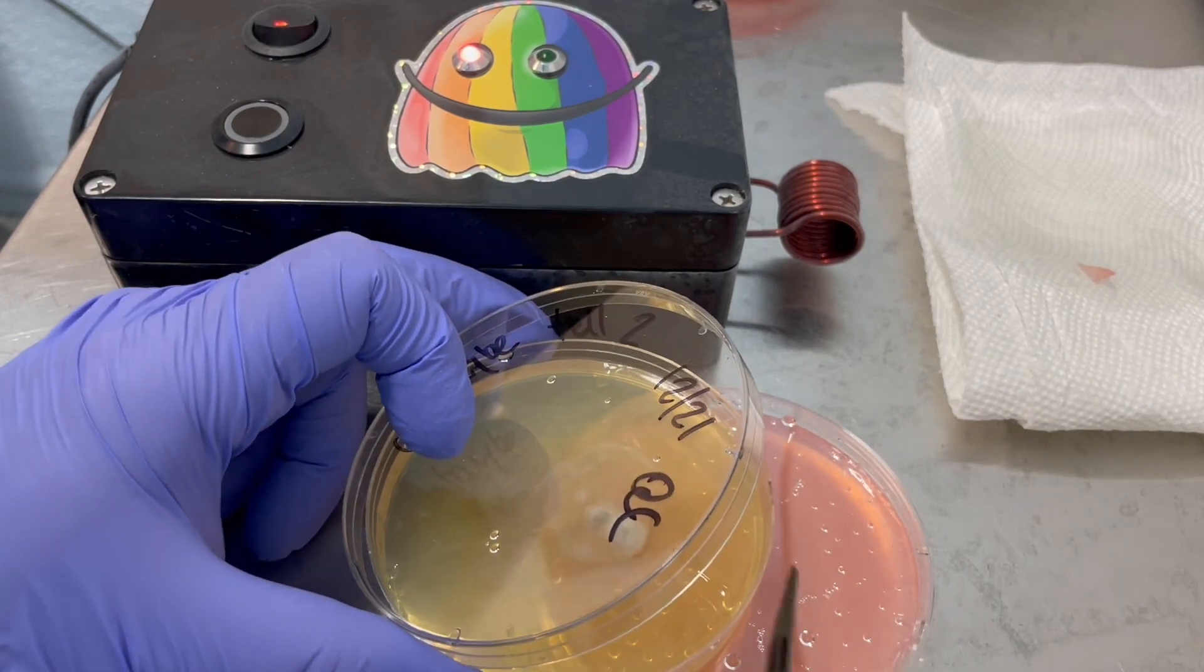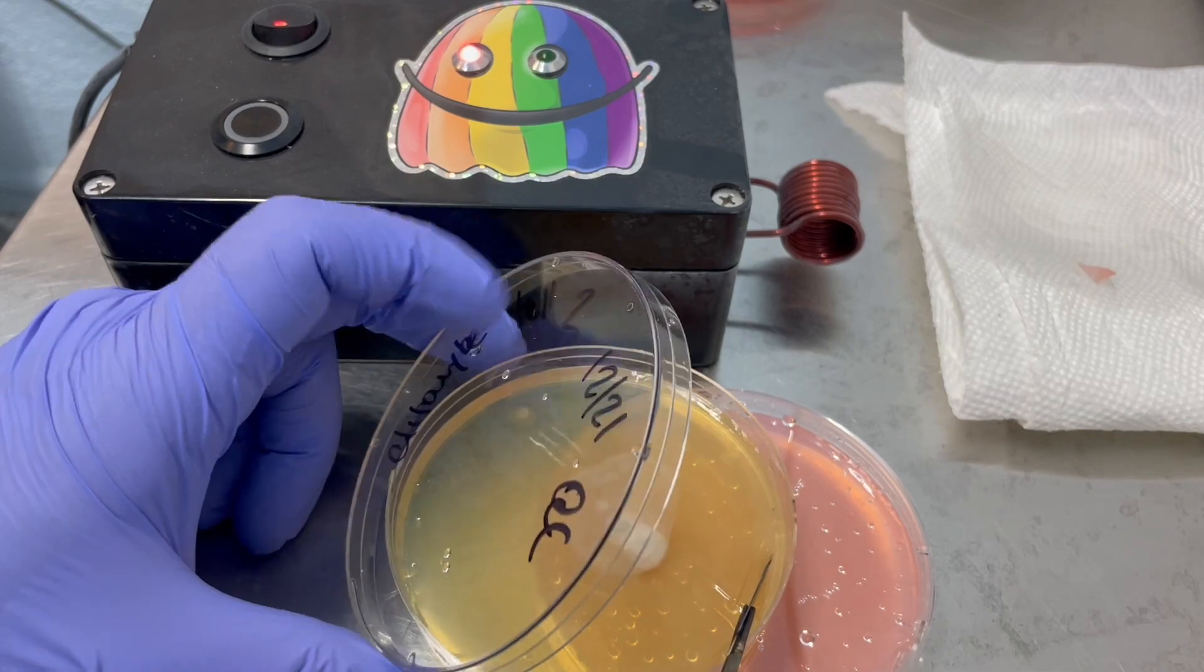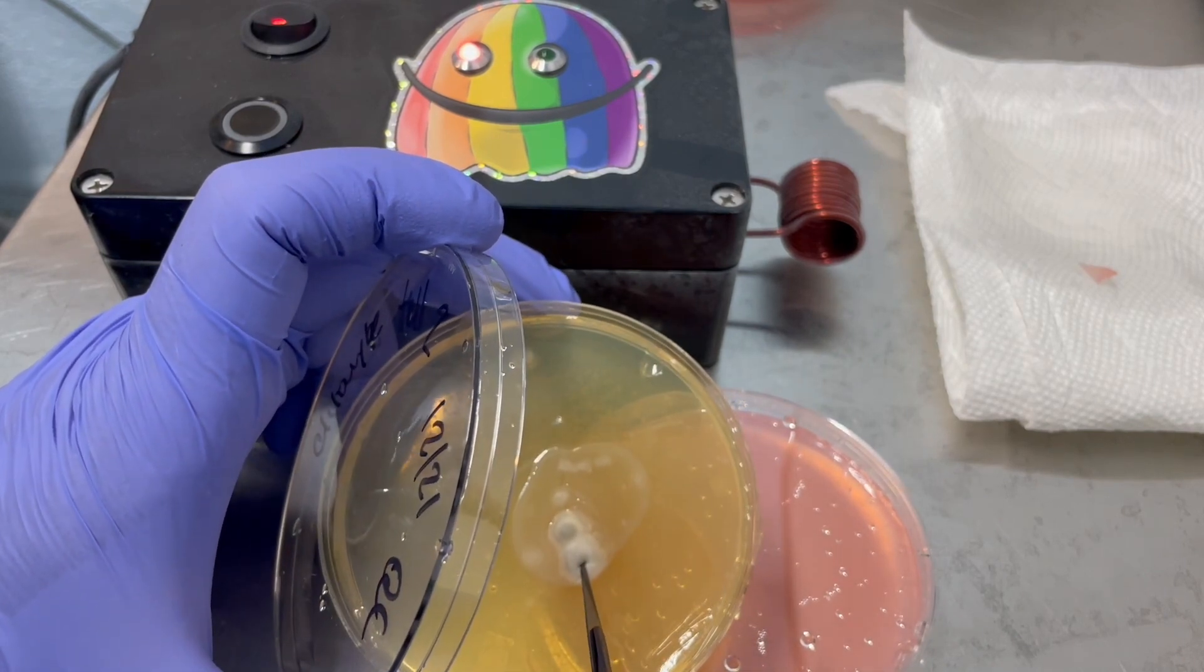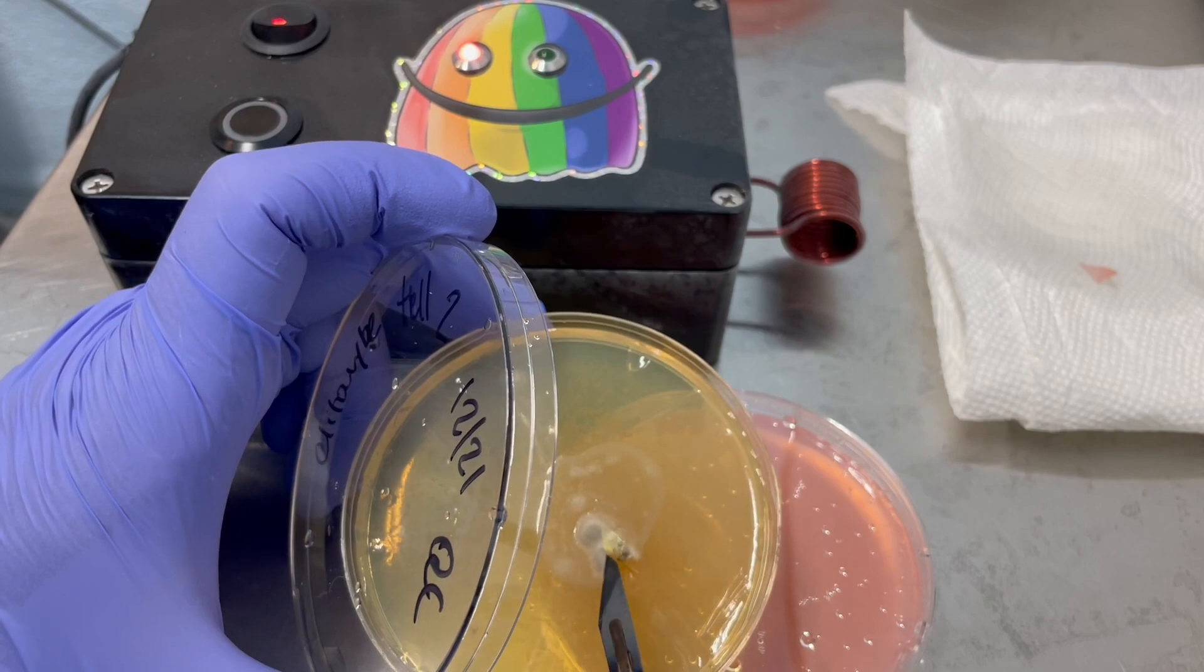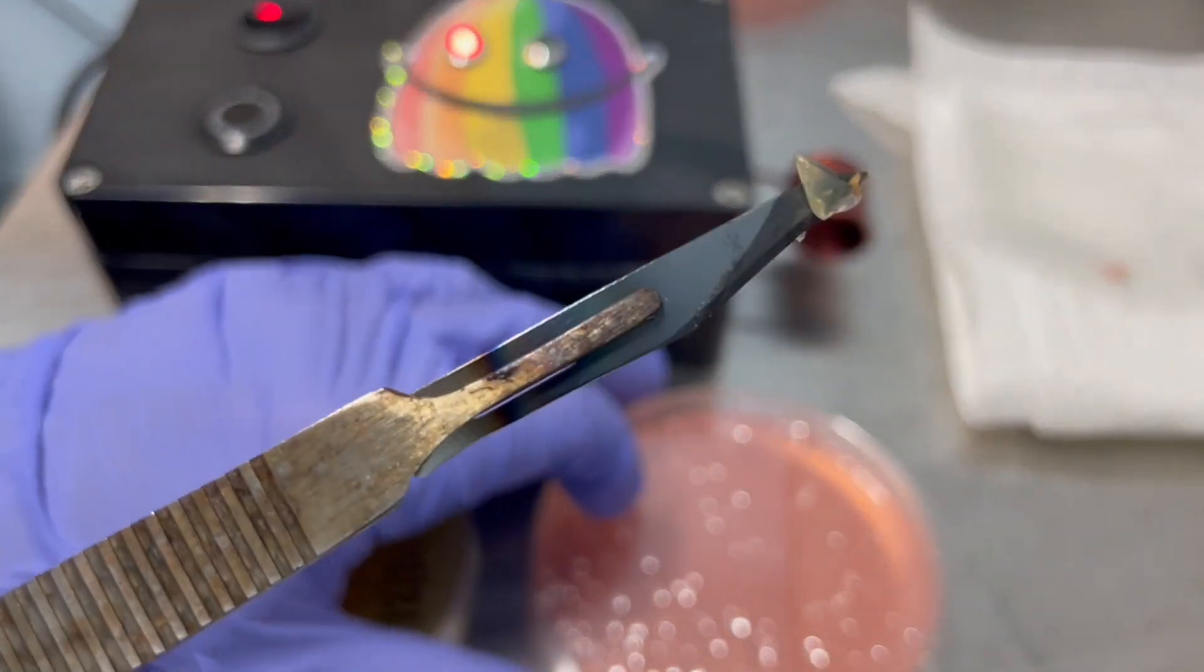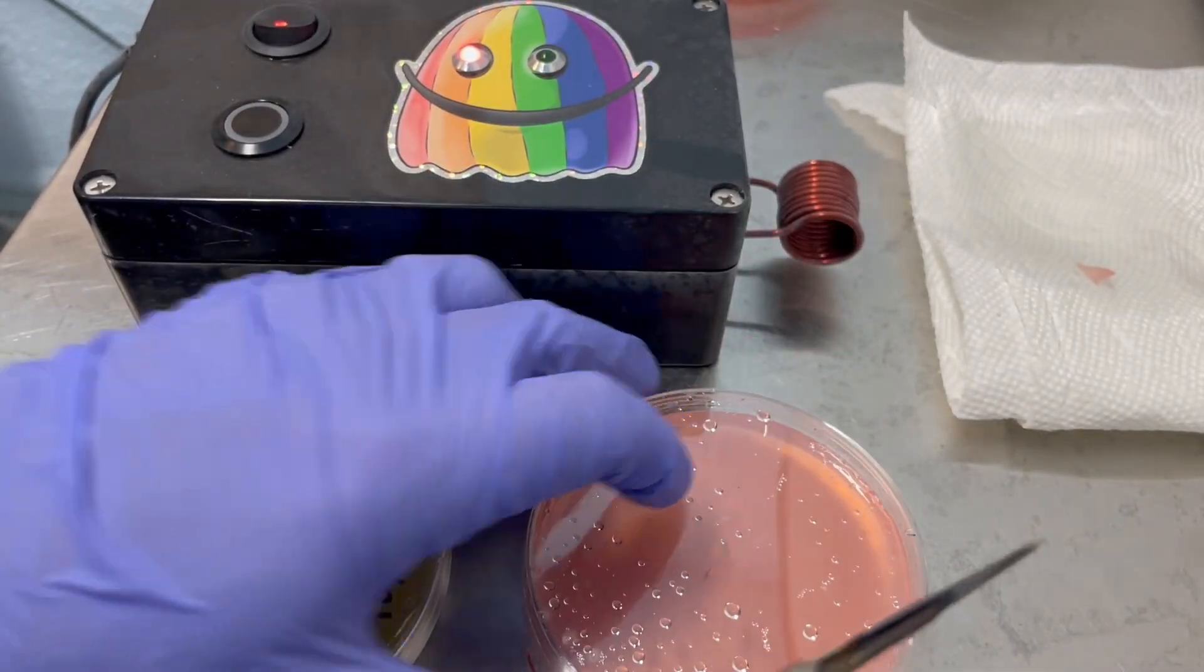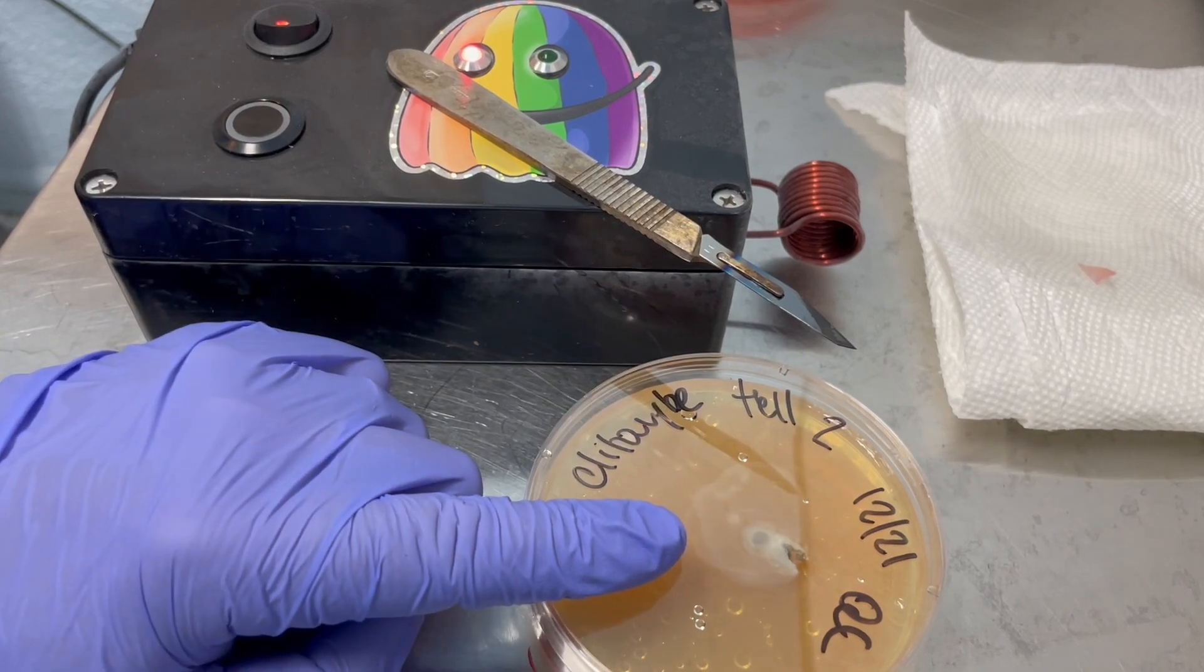And let's see if we can get this little corner here. This is going to be the trickiest one. So I'll cool this off in the corner. And because it's bacteria, I can really take that lid off. I love that clitocybe mycelium almost has like a purple tinge to it. But that's it right there. So it's got some mycelium right on the tip there. And that's all you need is just one cell.